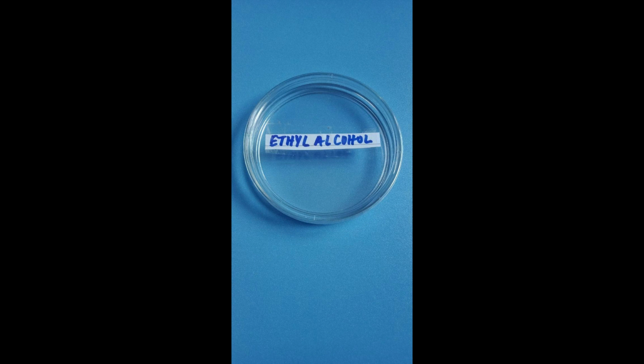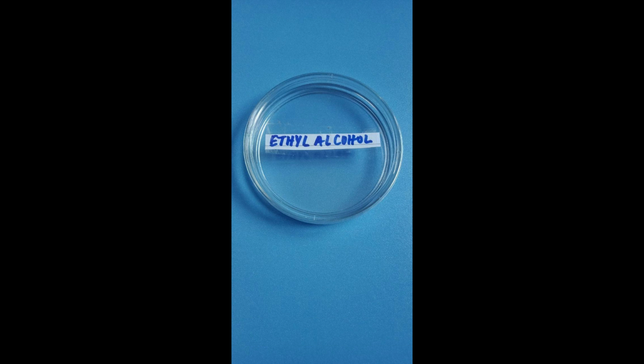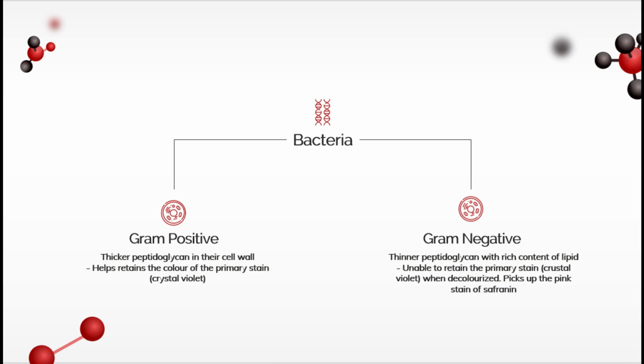The next step is decolorization, which distinguishes gram-positive and gram-negative bacteria. Application of a decolorizing agent such as ethyl alcohol or acetone may or may not remove the primary stain from the entire cell or only from certain cell structures. Gram-negative bacteria have much less peptidoglycan in their cell walls, so this step essentially renders them colorless, while only some of the color is removed from gram-positive cells, which have more peptidoglycan and a much thicker cell wall.